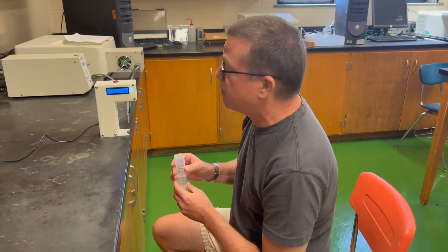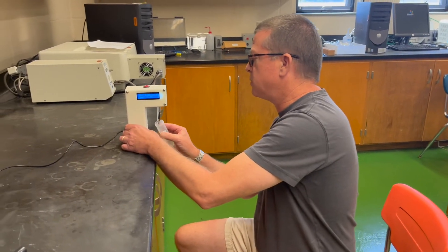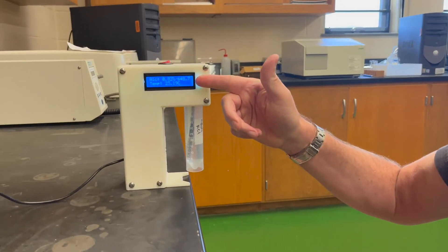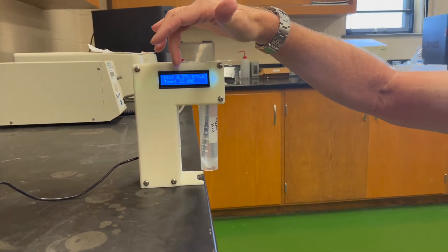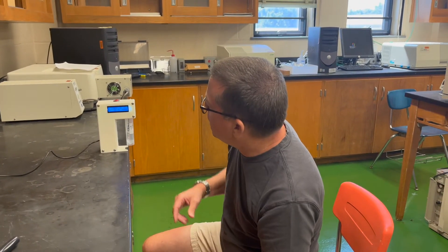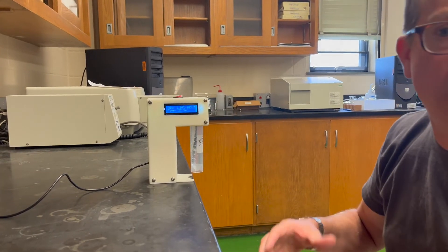Once the instrument is up and running — it does take a little time to warm up — we place the sample, which in this case is an ethyl alcohol standard I prepared. On the readout you'll notice we get counts. There's an internal calibration that gives a percent ethanol, but I prefer to read counts, shown on the right. The counts can then be related back to the concentration of the ethanol sample. Notice that after just about 10 to 15 seconds we have a nice steady reading — it's a very quick response time. That fast response is part of what you're paying for.